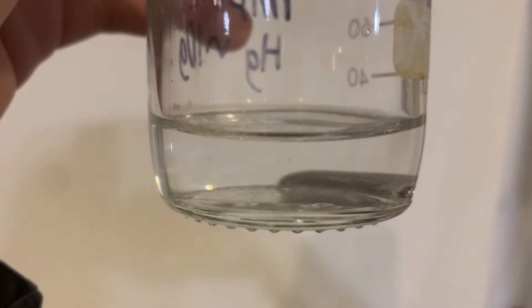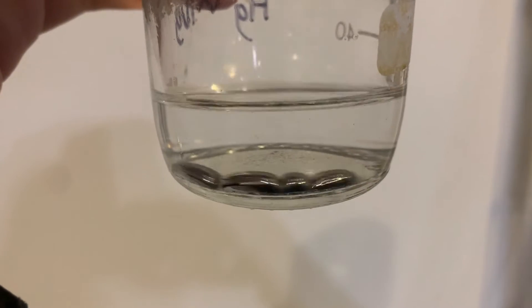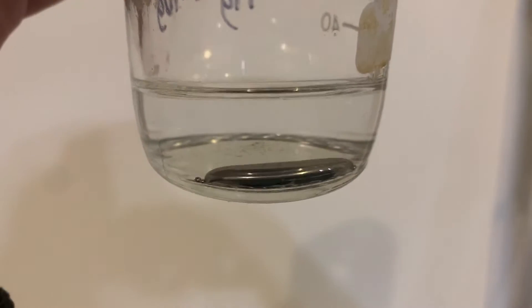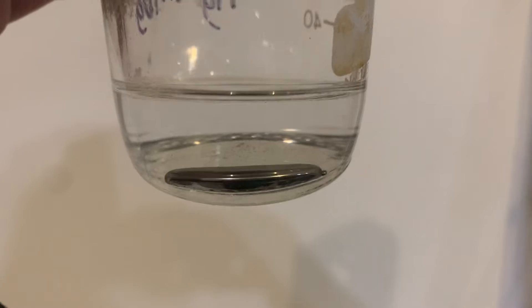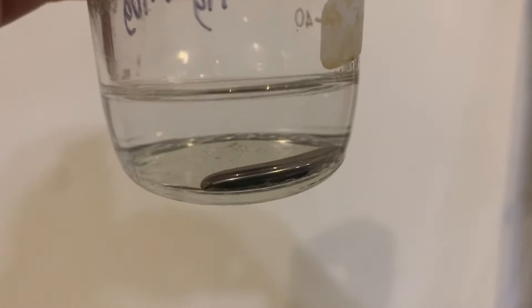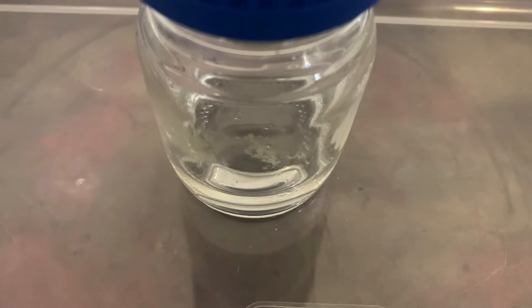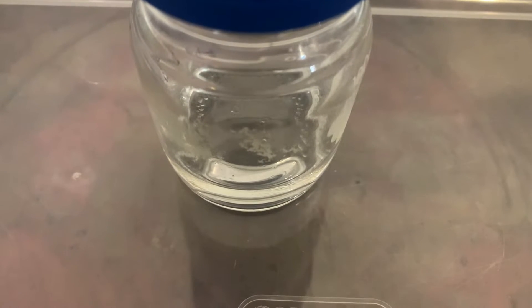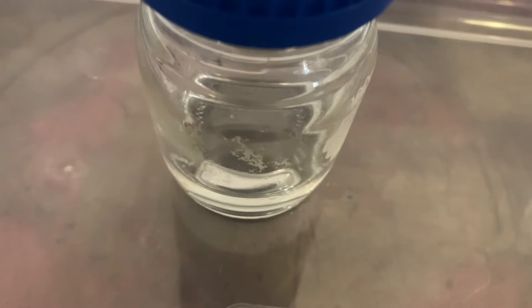I didn't really see if there was any fizzing — still can't really tell. It's definitely behaving a little differently. Whatever's going on, I'm not sure if the lighting is ideal, but it's only been a few minutes and at least in person it's clear that it's much shinier, so it seems to be working very well. It recombines much more readily than it did before, which is a very good sign. I'm going to leave it overnight and then replace the dilute acid with plain distilled water to suppress any vapors.